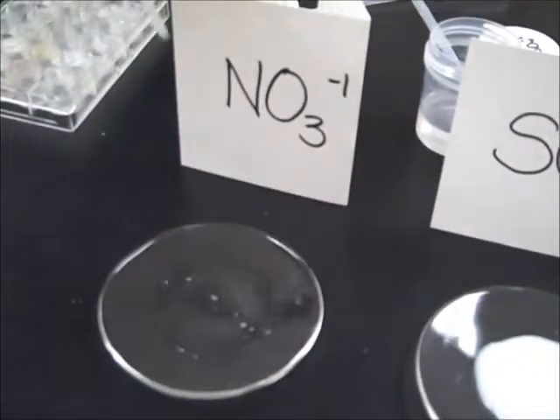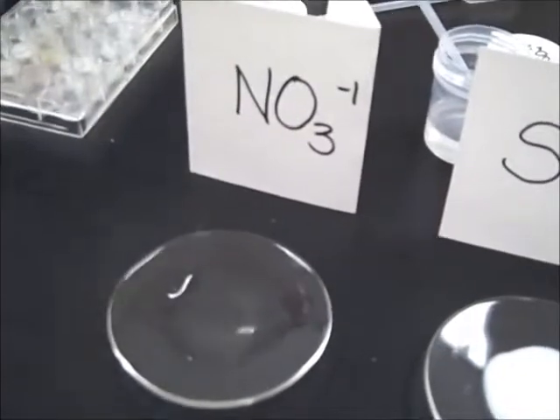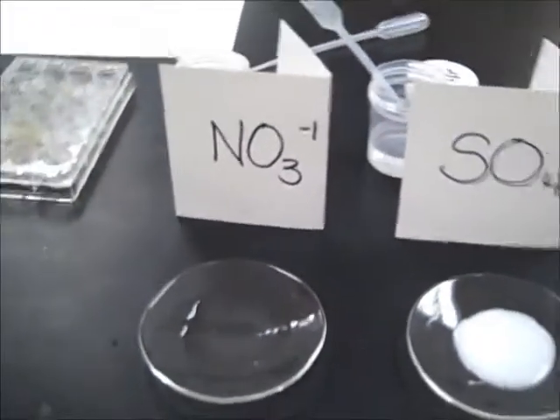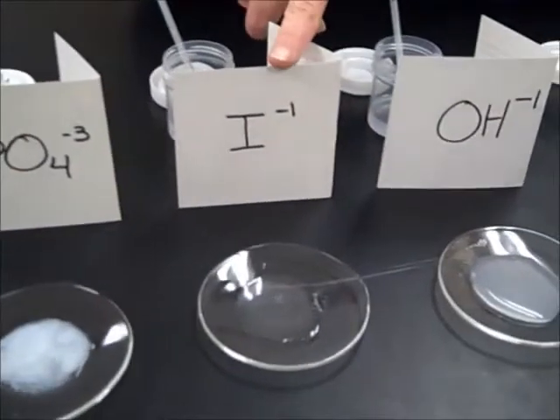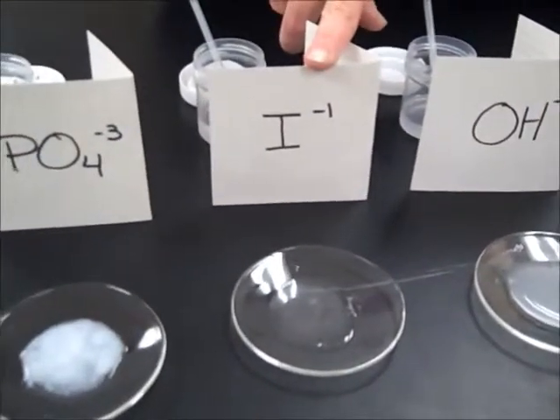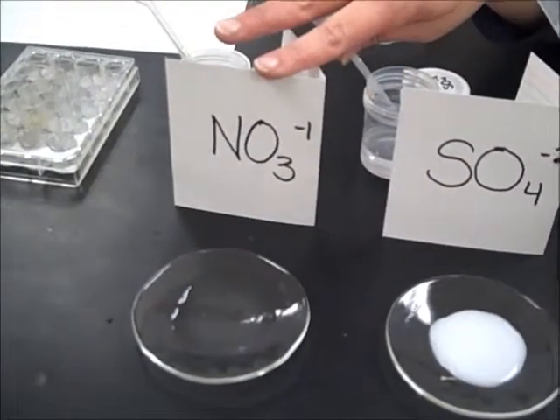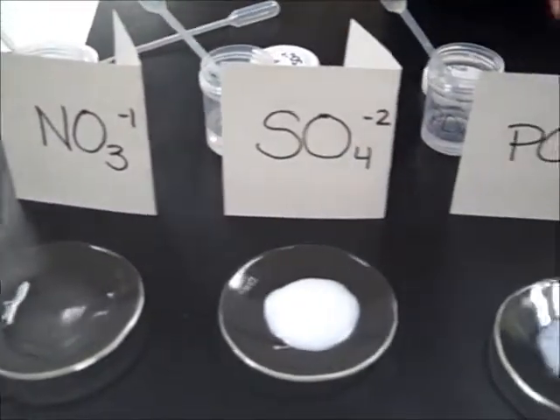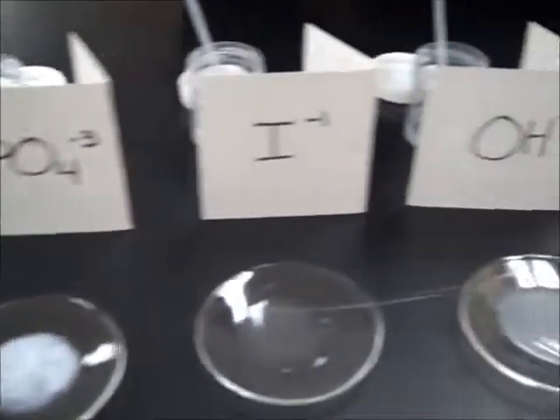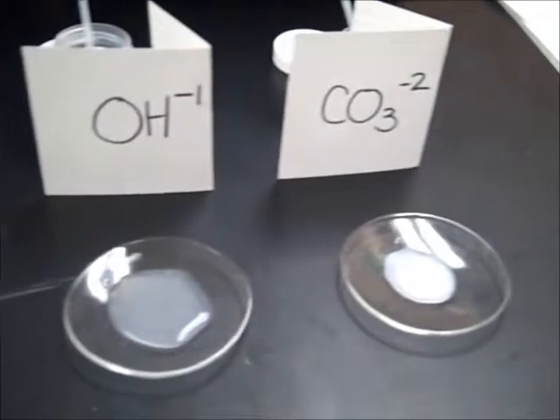And nothing. Yep, so we had 2 duds this round. We had the barium and the I minus 1 ion not doing much of anything, and also the Ba and the NO3 minus 1 ion not doing much of anything. But the other ones definitely had positive reactions that you can make observations on.